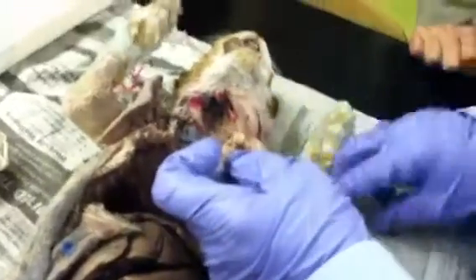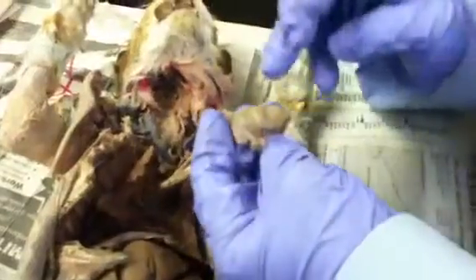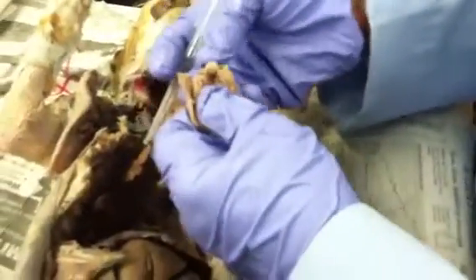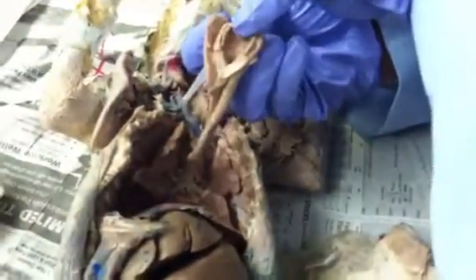When you look at the larynx, you have the hyoid bone, which is on top, and then you have the thyroid cartilage and the cricoid cartilage. And in back, you have the little arytenoid cartilages, which anchor the vocal cords. These are the arytenoid cartilages, and these are the vocal cords. And then this is the little epiglottis. That's the elastic cartilage. All the other cartilages are hyaline cartilage. The epiglottis is elastic. And then you have the hyoid bone above it. Those would be your vocal cords there.